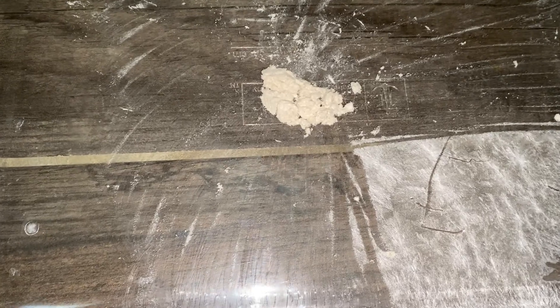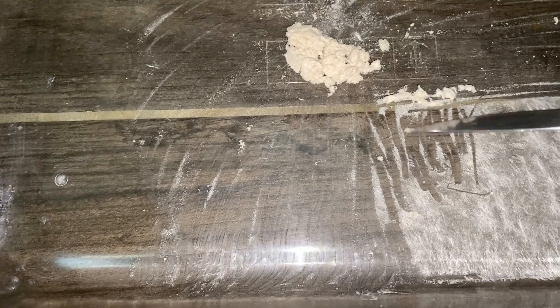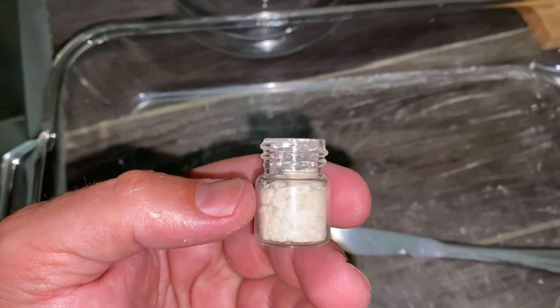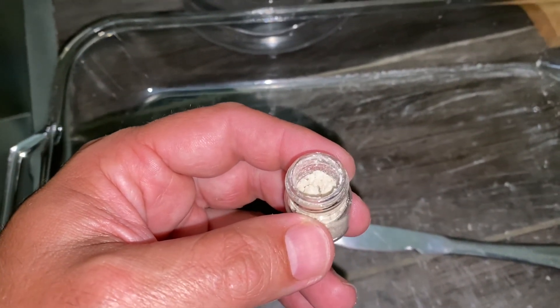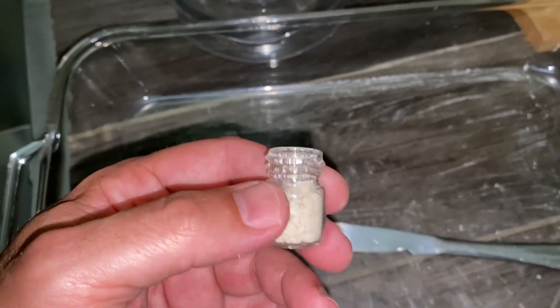I'm going to scrape this and we'll have our CBG powder. It scritches right up — kind of a nice waxy, almost soapy kind of texture, but looking pretty good. There's your CBG. It may have some other plant wax, terpenes, and anything else that's soluble in alcohol that the plant might produce, but mostly CBG, I'd bet.